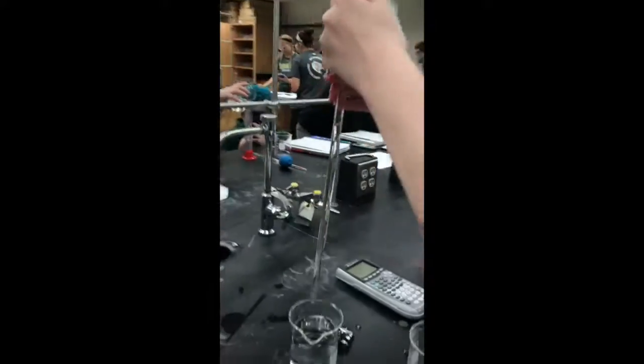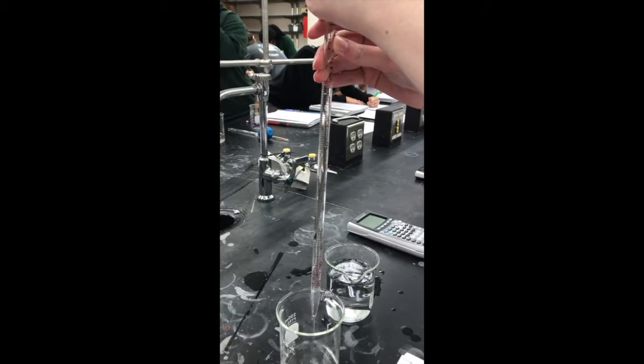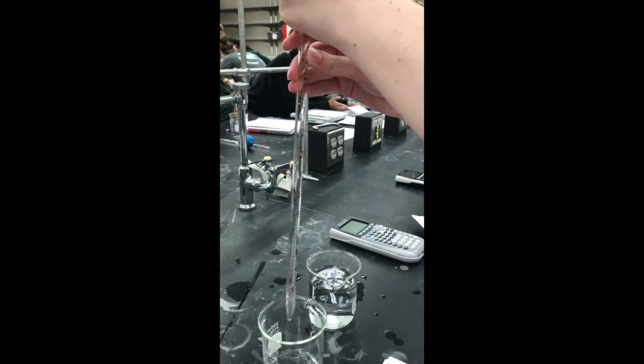by surface tension. I record the initial volume, which is 0.18 milliliters, and then I drain the water into a separate container. I stop before the water passes the 10 milliliter mark. Then I record the final volume, which is 9.79 milliliters.